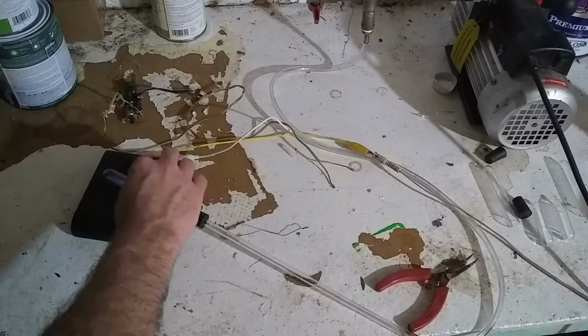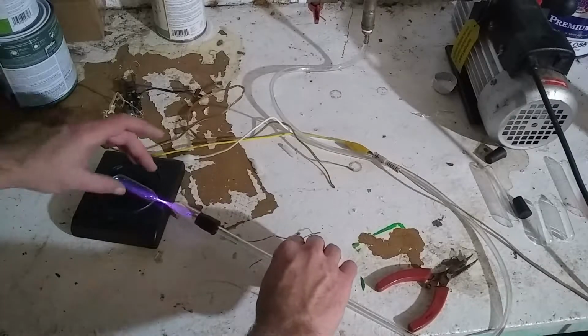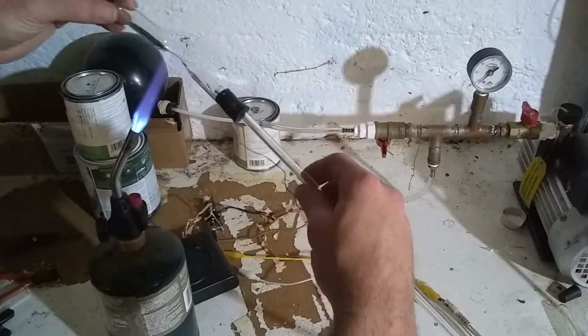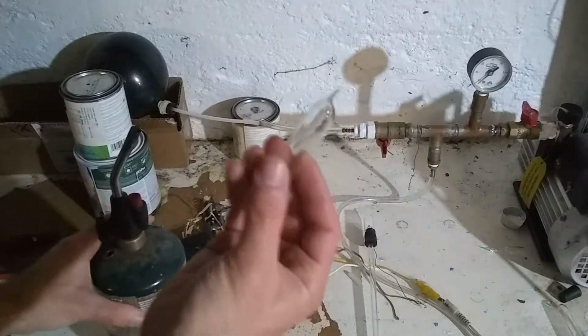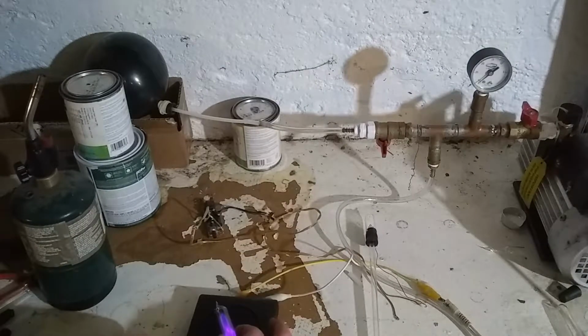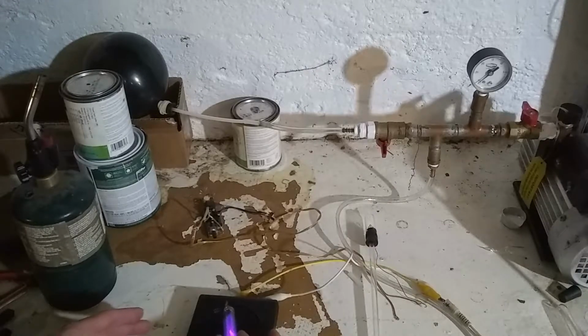That is, come back, not air glow. It's redder, and it looks different, so let's hope I can seal this one off without problems. Okay, hopefully. Yes! Ha! And there it is.